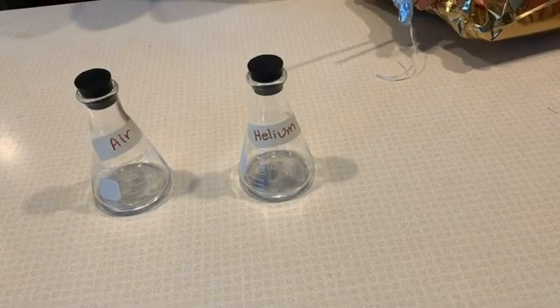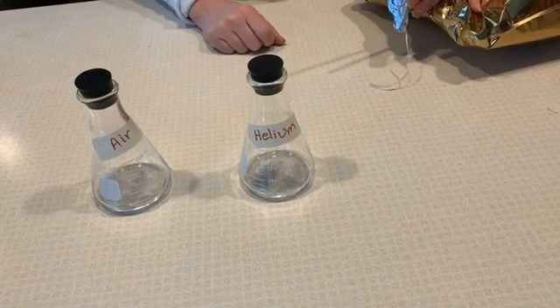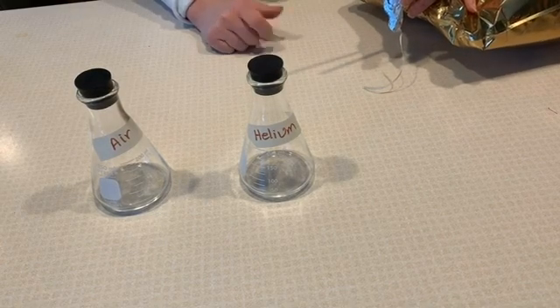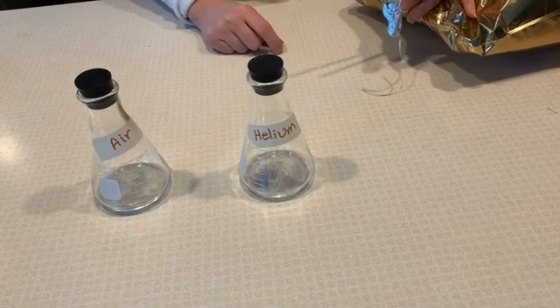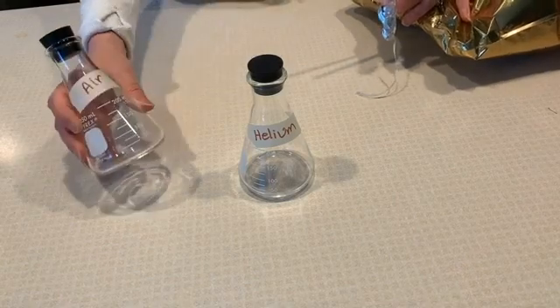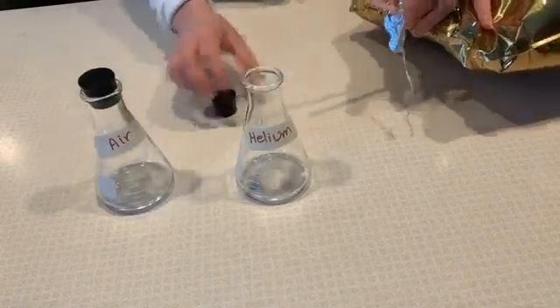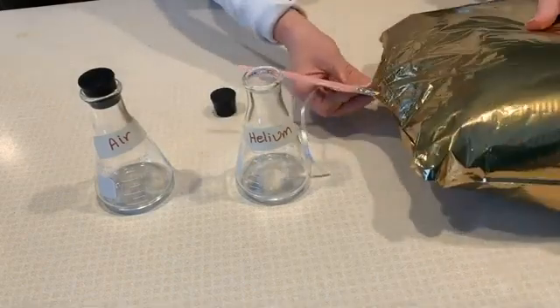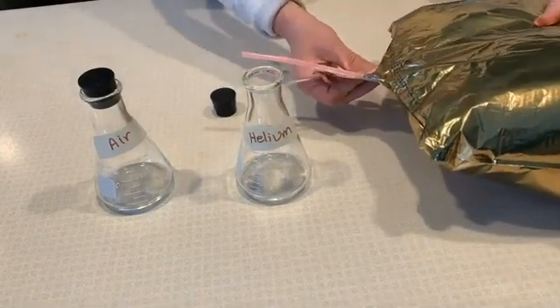Okay, we have two gases here that we're going to test. These are our control gases. Based on our property data table, we know what should happen when we test the flammability of both of these. I have one flask that's filled with air and one flask ready to be filled with helium from my balloon that I got at the store.